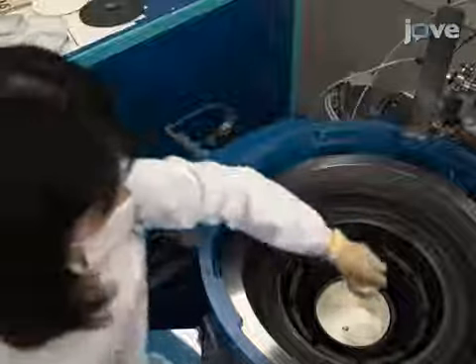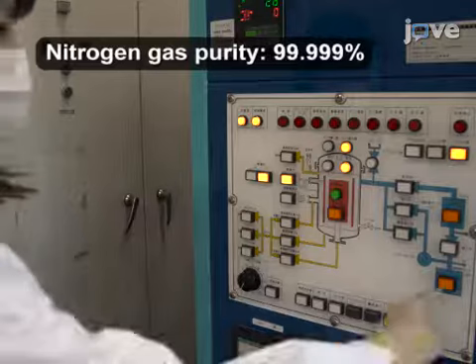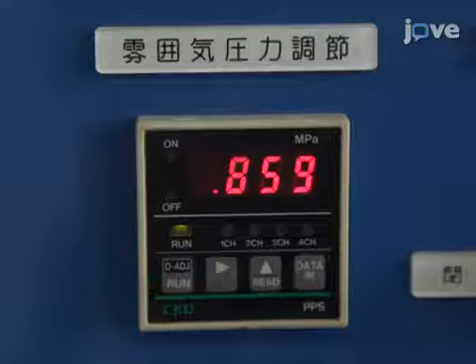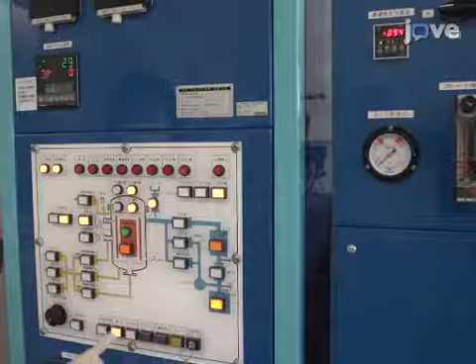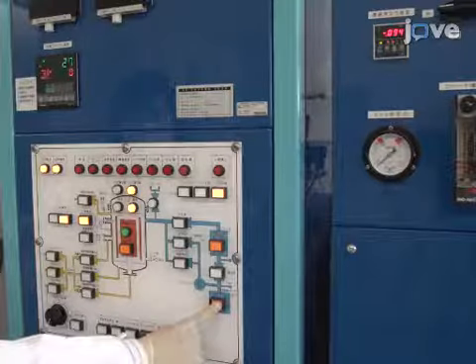Place the crucible in a sintering furnace. Create a vacuum on the inside of the chamber. Keep the furnace temperature constant during firing. Once firing is complete, turn off the furnace and allow the sample to cool to room temperature inside the sample chamber.